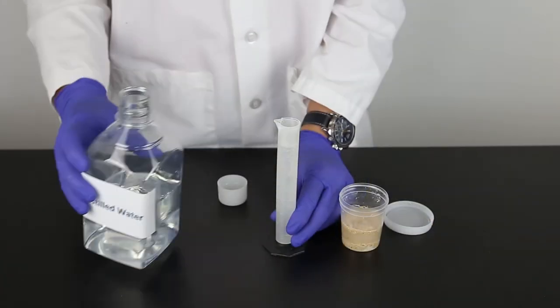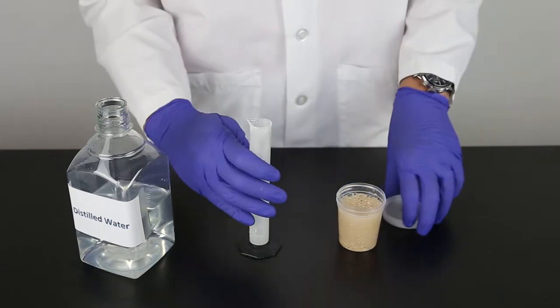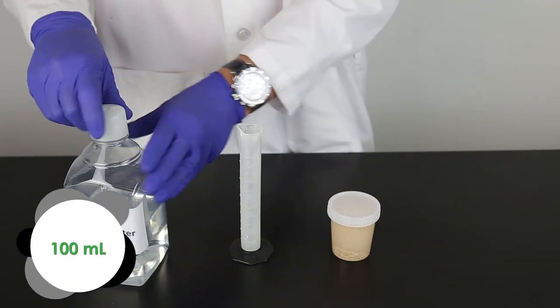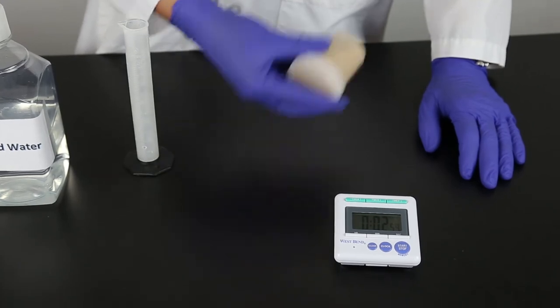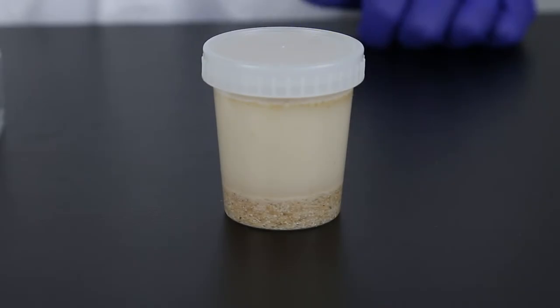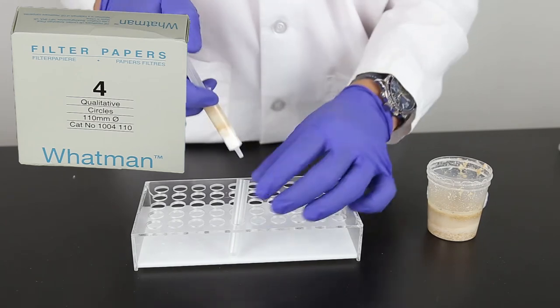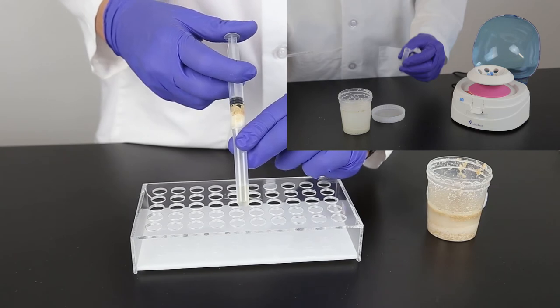The sample is extracted with a ratio of one part sample to 10 parts distilled or deionized water. For this example, we're using 10 grams of ground sample with 100 milliliters of distilled water. Vigorously shake for three minutes using hand or mechanical means. Allow the sample to settle and filter with a filter syringe or Whatman number 4 filter paper. You can also pipette the sample into a 2 milliliter microcentrifuge tube and centrifuge for 30 seconds.